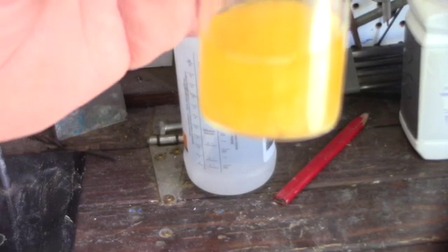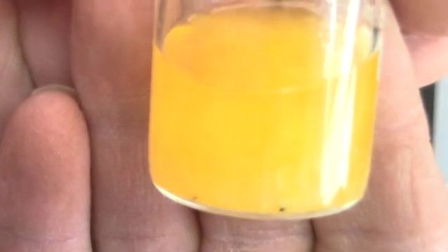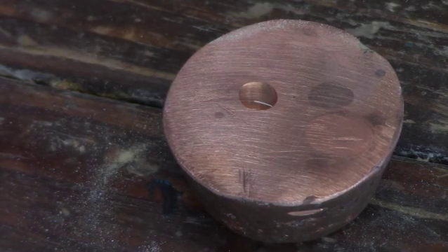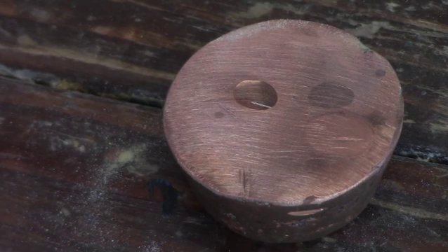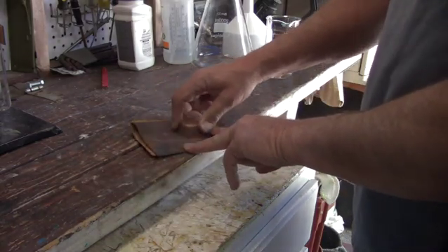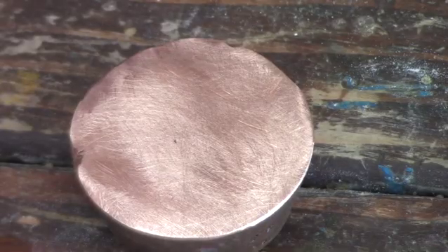Here's the solution — the gold is still dissolving in the bottom and you'll notice it's kind of milky. I put in a filter from our previous experiment, the filter I used when I filtrated the test tubes, to verify the status of our aqua regia as far as having excess nitric acid. I put a drop on this copper here and you will notice that it is turning green, so we do have excess nitric acid. We then wipe the acid off the copper and use 200 grit sandpaper to polish the front of it, clean it up, and get the old stains off so we have a good clean reference to start with.